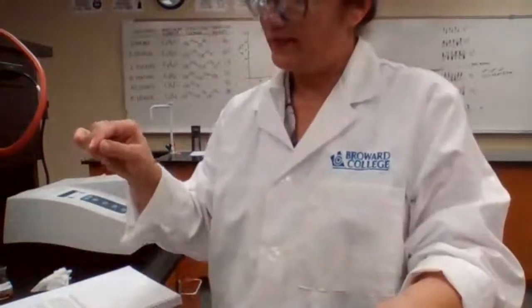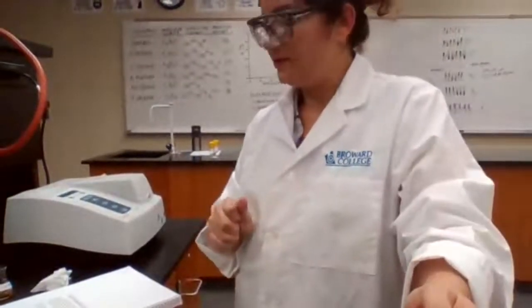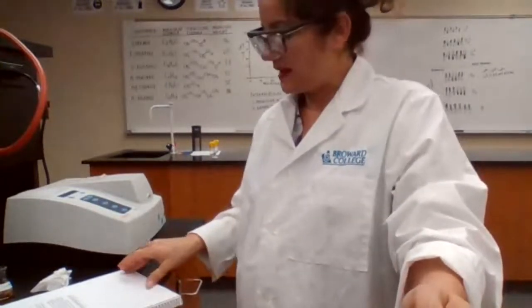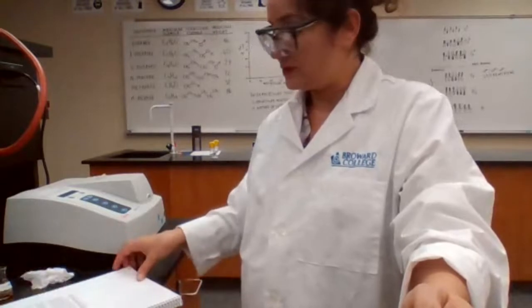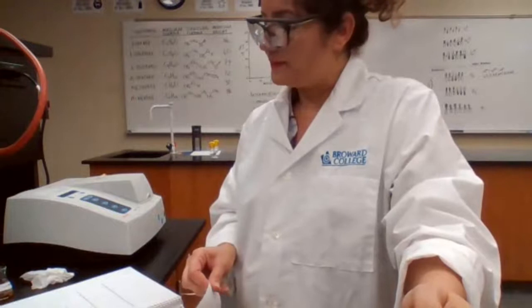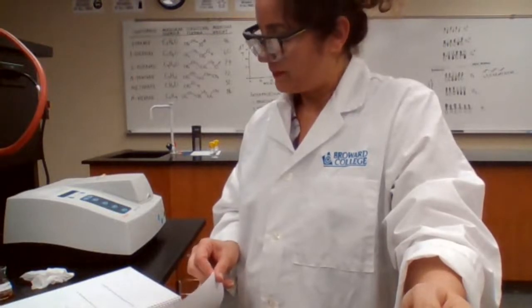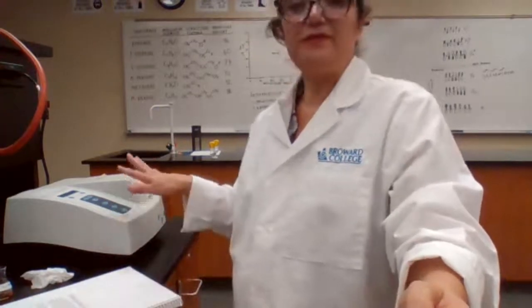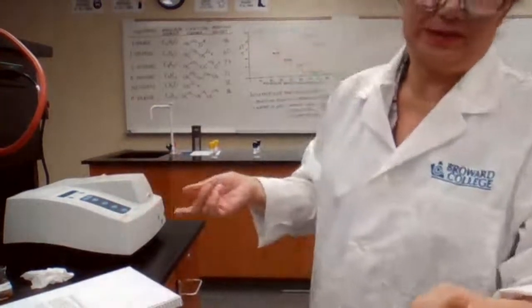And for unknown B, I have to wait to 2:18, 2 more minutes. So when you have your calibration curve, you have to look for the concentration and use the calibration curve in order to find the concentration for the unknown A or unknown B. The instrument, if it's calibrated today, it needs to be calibrated next day.